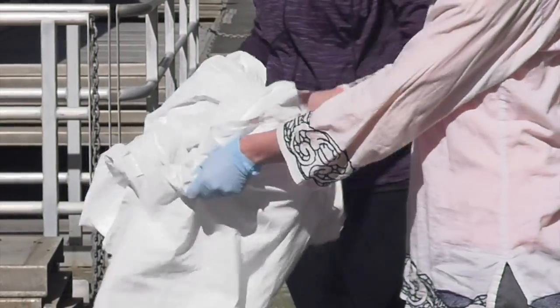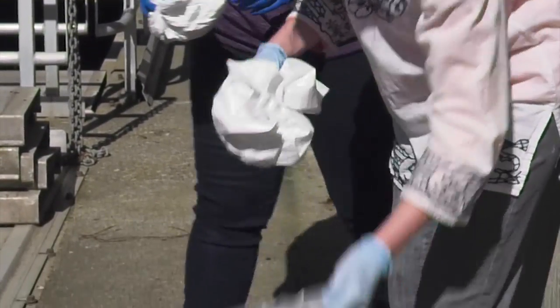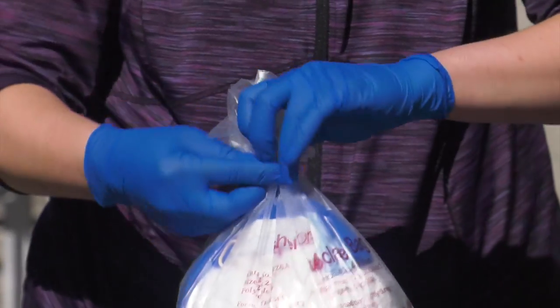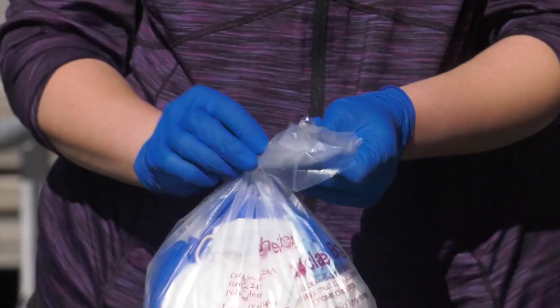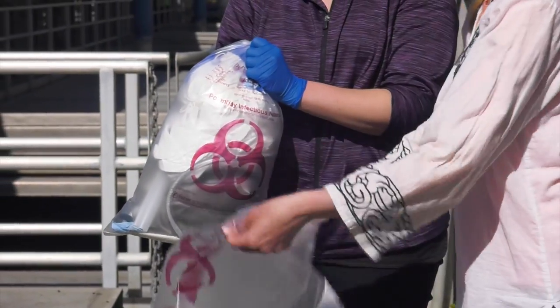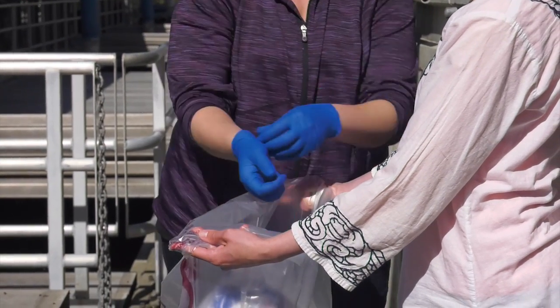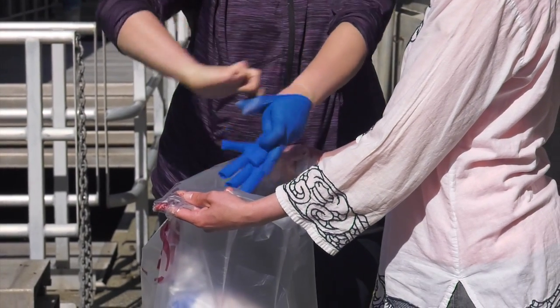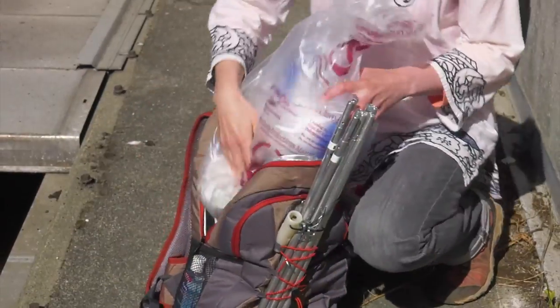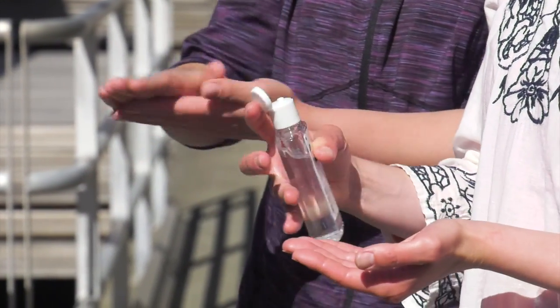Place all remaining waste items and personal protective equipment in the small waste collection bag, including lab coats, face masks, and lastly gloves. The clean hands technician should don a new pair of clean gloves and close the bag using a fastener. They can then place the small waste collection biohazard bag and the rope storage biohazard bag inside the large secondary containment biohazard bag. Finally, the clean hands technician should place their gloves inside this bag and fasten it closed. Carry out your waste in the backpack. After clean-up is complete, all active team members should use the hand sanitizer.